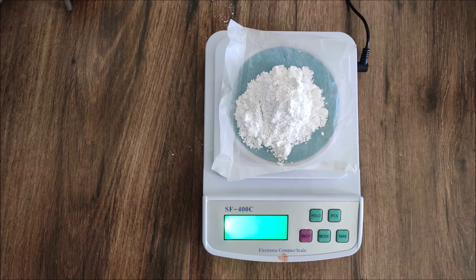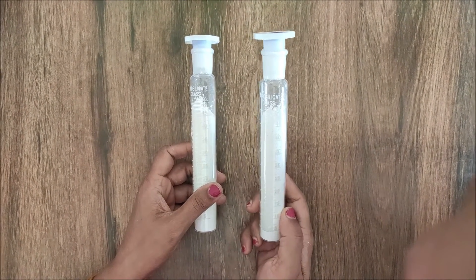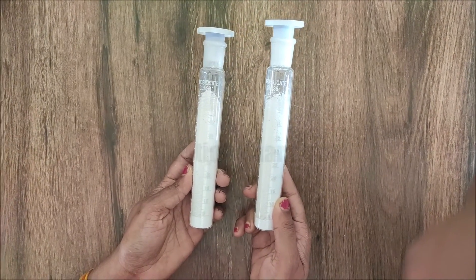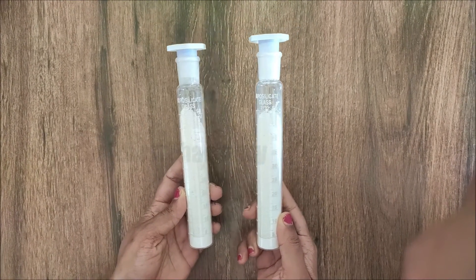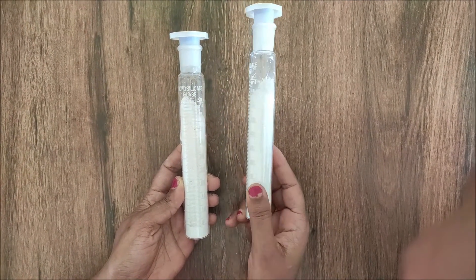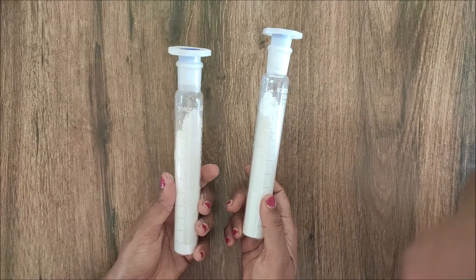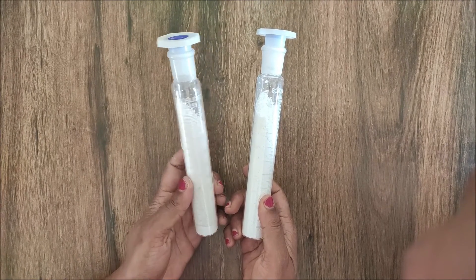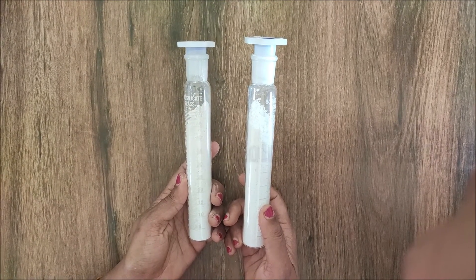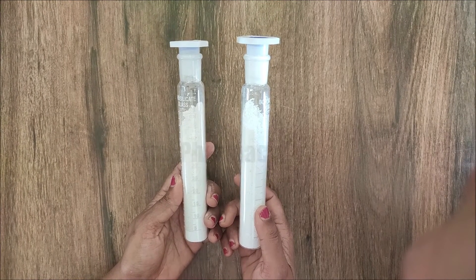After weighing 25 grams, transfer the powder into one measuring cylinder with the help of a spatula, and fill the other measuring cylinder with 25 grams of powder the same way. Here you can see we have already filled both measuring cylinders with the powder, and after this we cap the measuring cylinders. Our measuring cylinders are 50 ml capacity, so we weighed 25 grams of heavy powder to fill them up to about the 40 ml mark. If using a 100 ml cylinder, weigh about 50 grams of heavy powder to fill it to about the 75 ml mark.